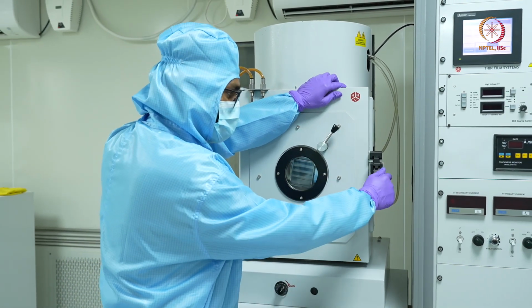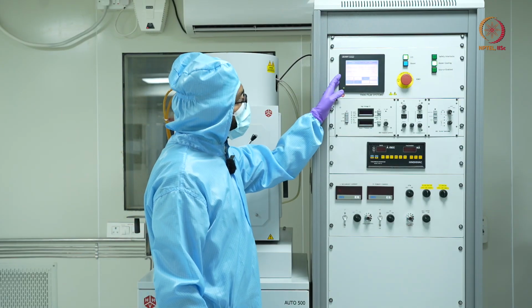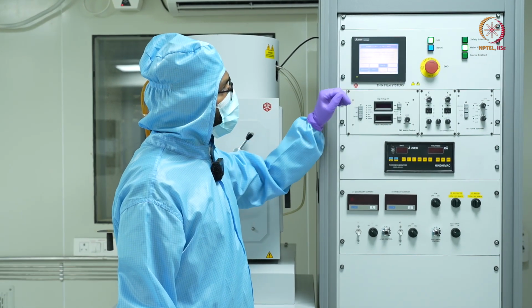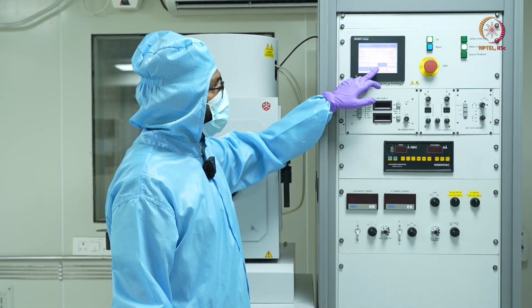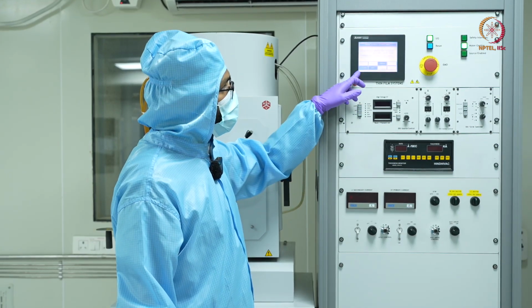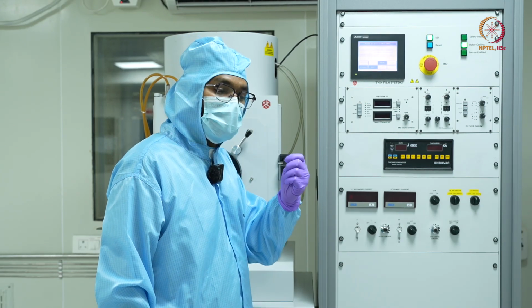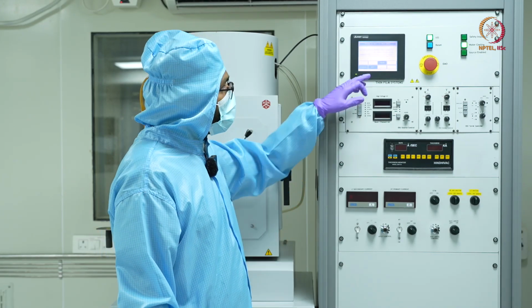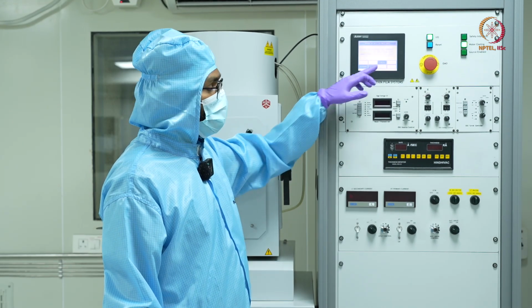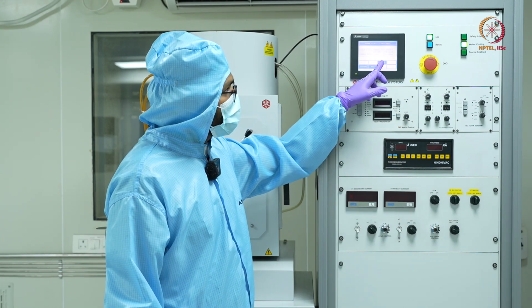So I'll just lock my door, and here you can see we have 3 options available to us: the cycling, process and sealing. Process is when we want to start the deposition. But right now it won't be possible because our chamber is not at vacuum condition, rather it's at atmospheric pressure. Another option is to seal, but we won't be using that option here. What we need to do here is start the evacuation process. That is, here we have the cycling.